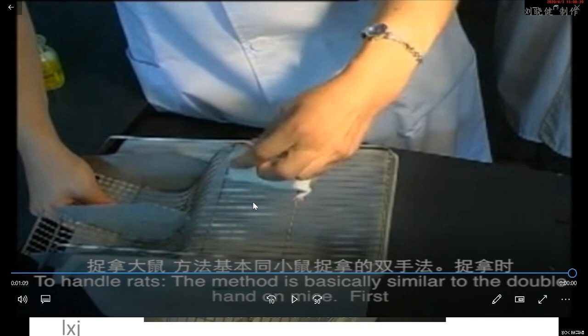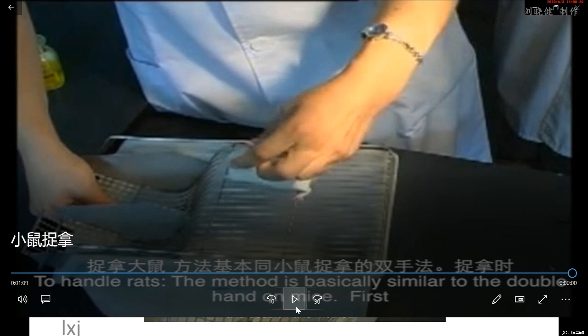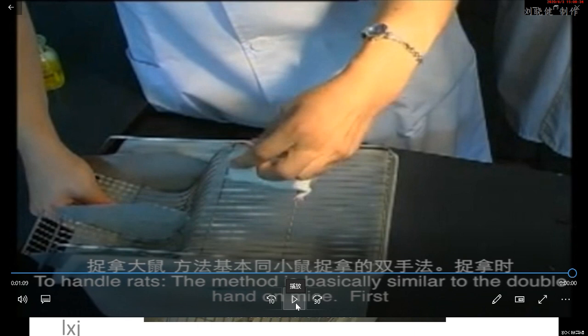You need to do some medical research. Mouse also is a very common animal during your experiments. So please watch it again and watch carefully how to handle the mouse.